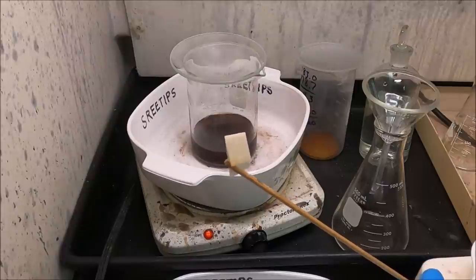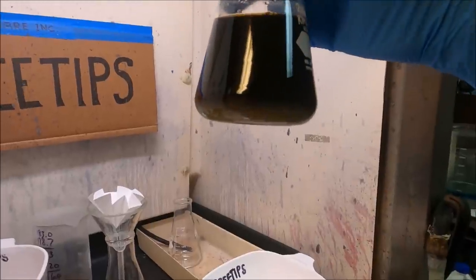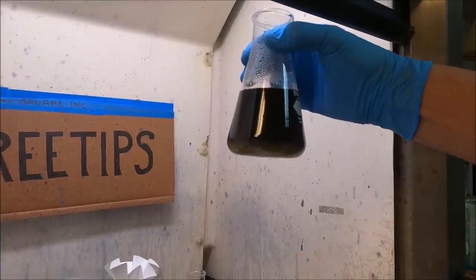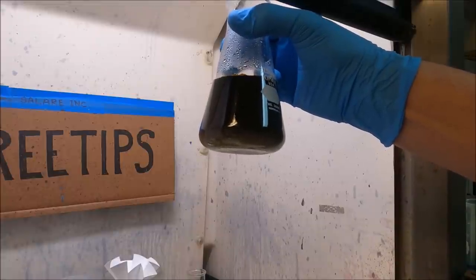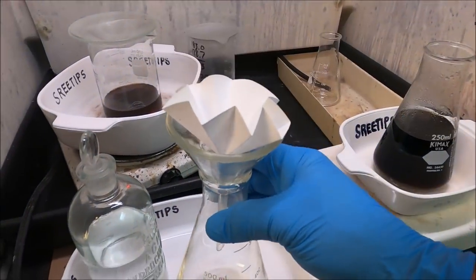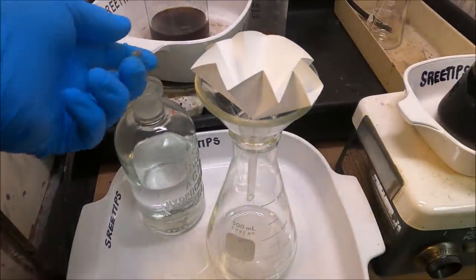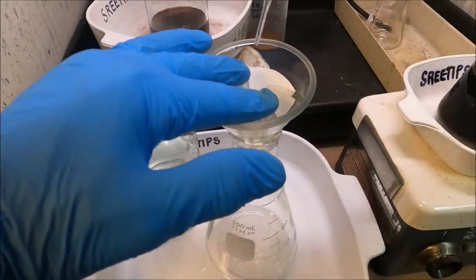I don't see a very big reaction going on, so I don't know what we got back here. Any professional refiners watching - comments in the comments section would be greatly appreciated. Let's get a quick look at this solution here. There is some very fine grain yellow precipitate down there, not much, but the thick mud has gone out of there. What we're going to do now is filter the yellow precipitate out of our solution and then go for palladium.